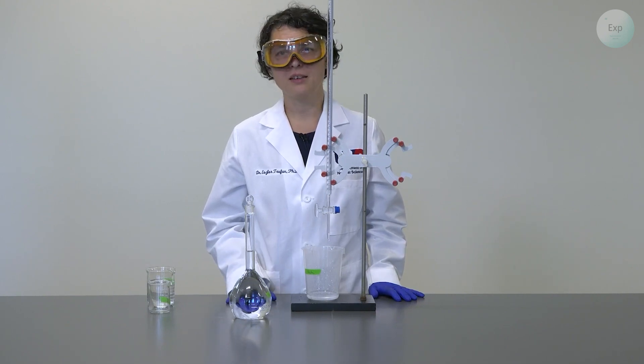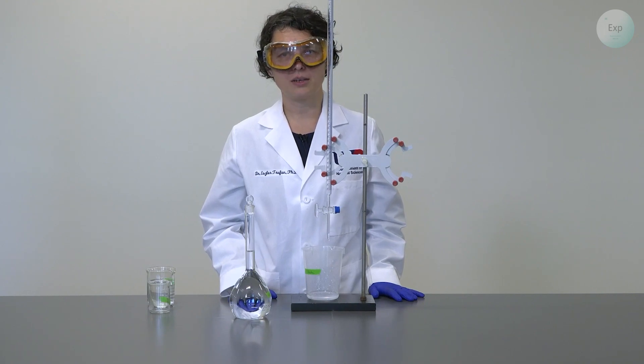And then, after you completed it three times, you are ready to add your charging liquid.